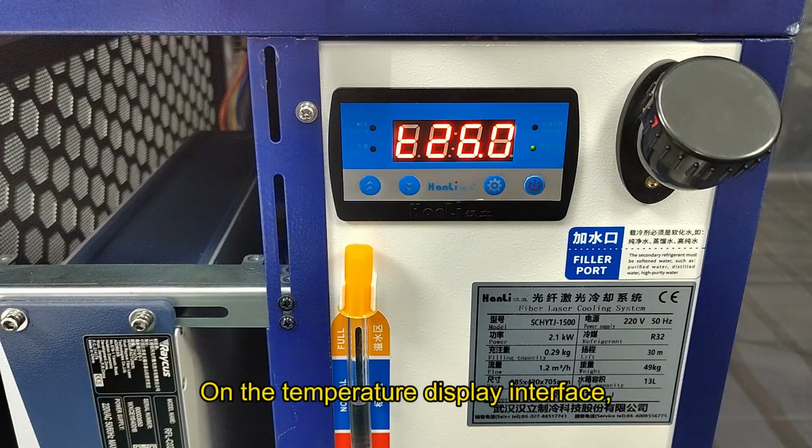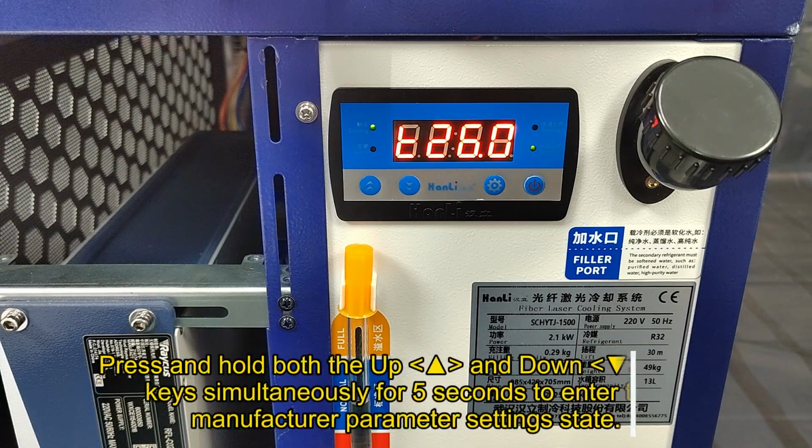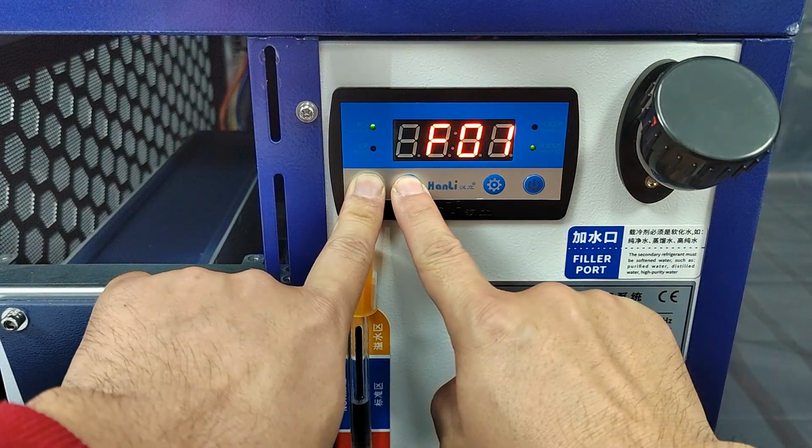On the temperature display interface, press and hold both the up and down arrow keys simultaneously for 5 seconds to enter the manufacturer parameter setting state.